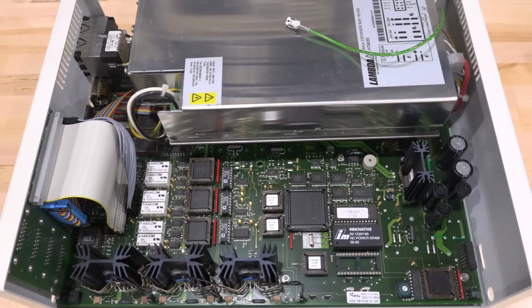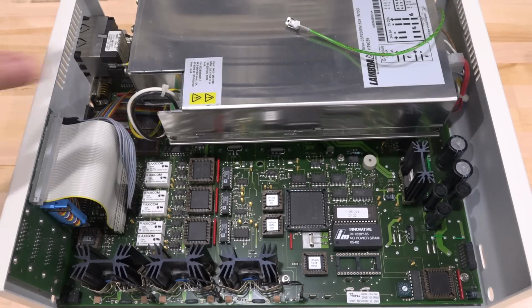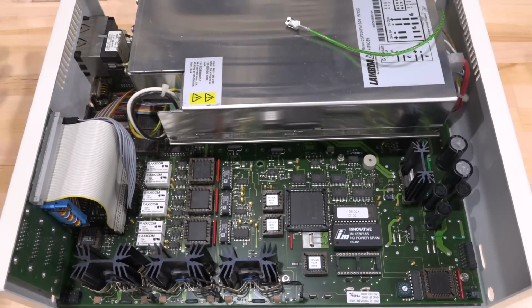It wasn't so straightforward, but once you get a good hang of it, you can do a lot with these. Big power supply sitting here at the top. The rest of it is really nothing unusual; this is exactly what you would expect to get from something that tries to create an abstraction layer around a whole bunch of motor controllers.